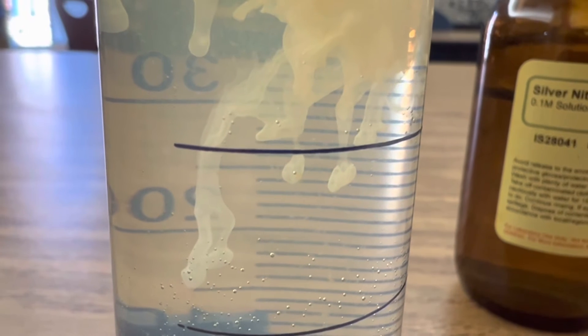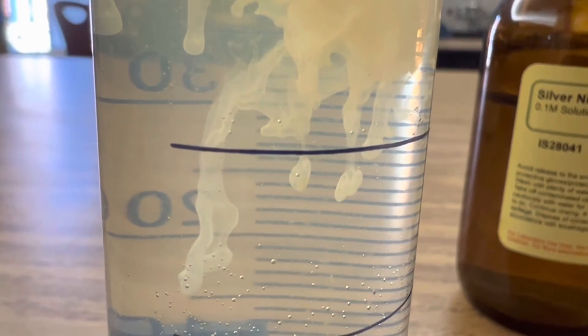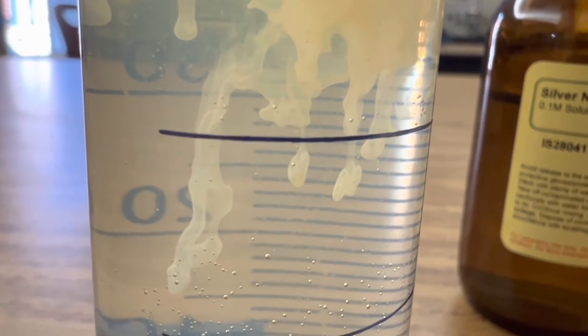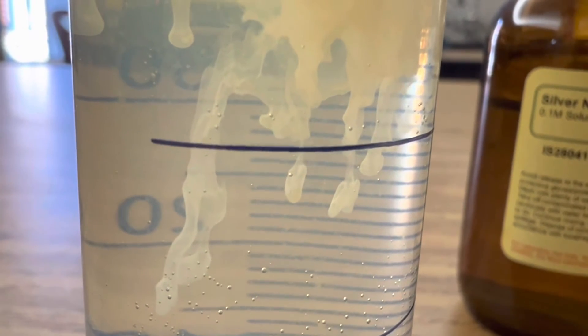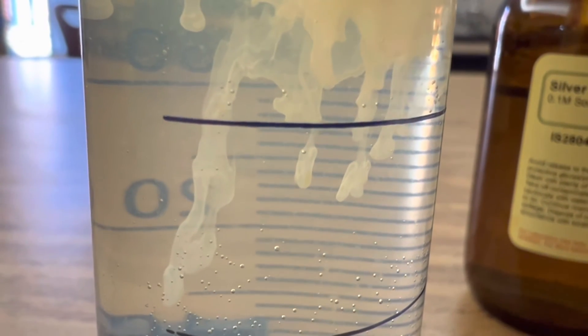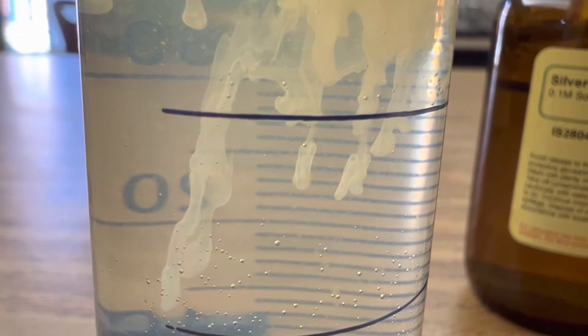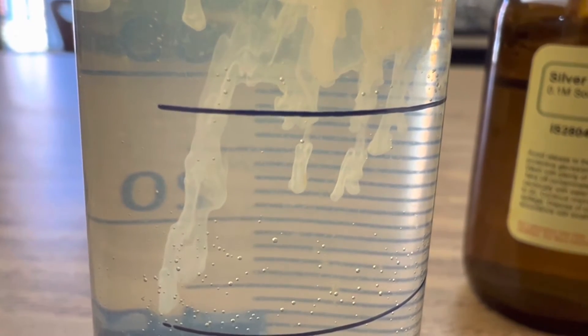Here's a close-up of that silver sulfate starting to precipitate right out of the solution. Just beautiful. Just look at that amazing insoluble solid of silver sulfate. That is amazing.